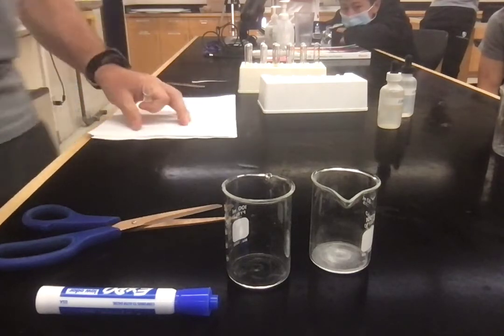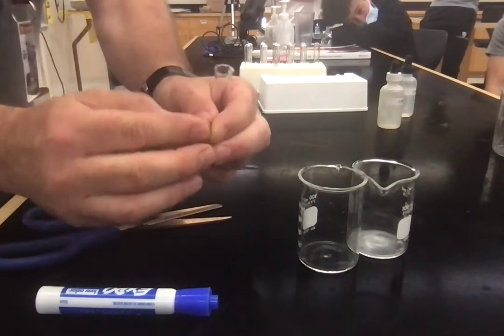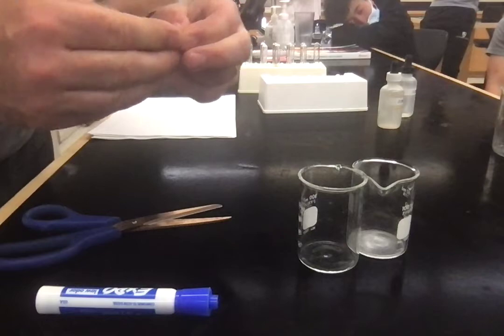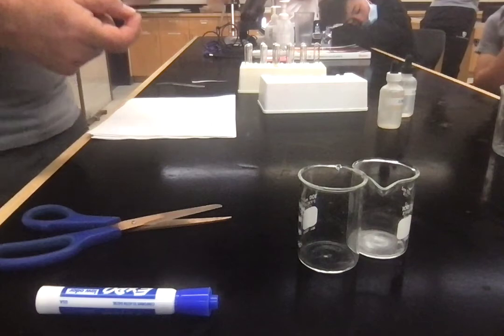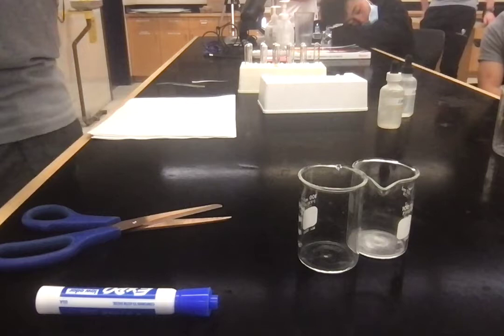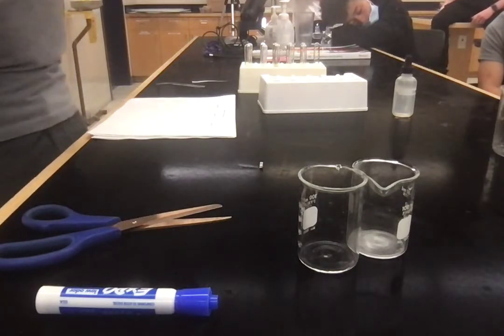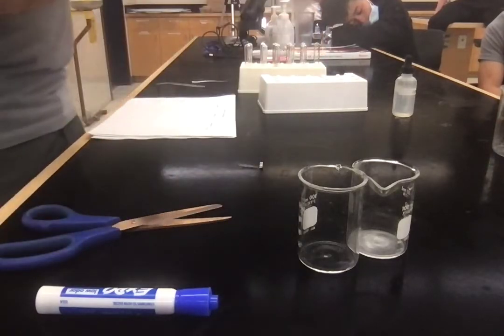And you'll see why in a second, but I'm going to fold the magnesium into a little ball. I folded it in twice, and then I'm just going to curl it up so that it's kind of squashed a little bit. I'm just going to show that to the camera, so that people know what to do. And then I'm going to use this squashed up piece of magnesium in my tube. Actually, I'm going to take it out of the tube. And I'm going to use 2m. It's molar. It's just a way of measuring the concentration. So I'm starting with 2 molar of hydrochloric acid.